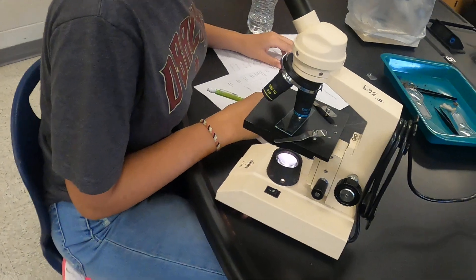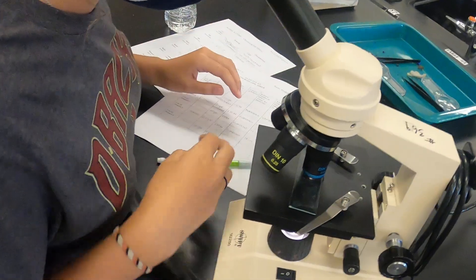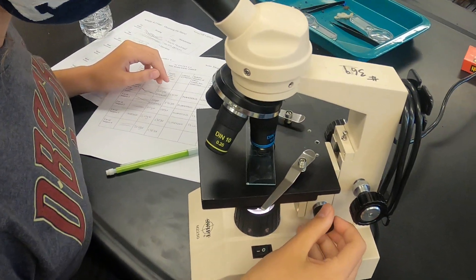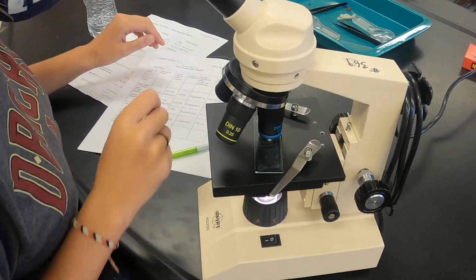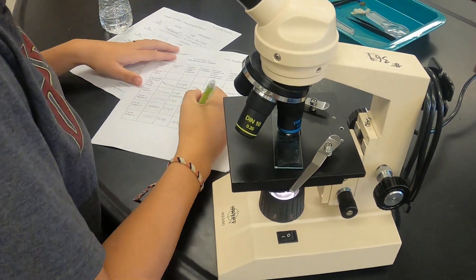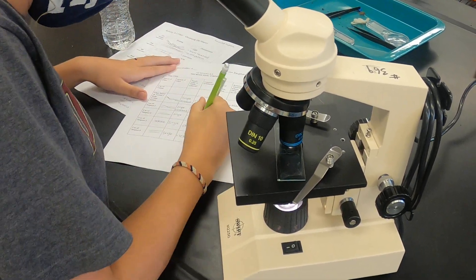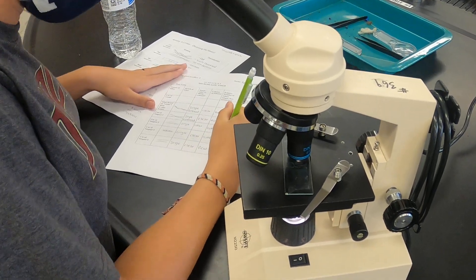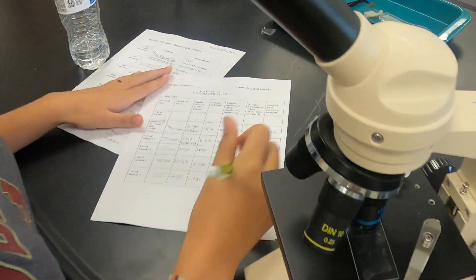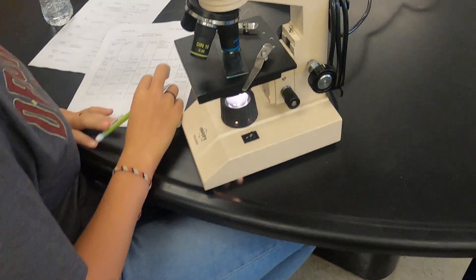Today what they're doing is they had to identify all the differences between natural fibers and synthetic fibers, and then they had a crime scene and they had to determine which one of these suspects matched the crime scene using their fiber and looking through the microscope. Let me see your paper.